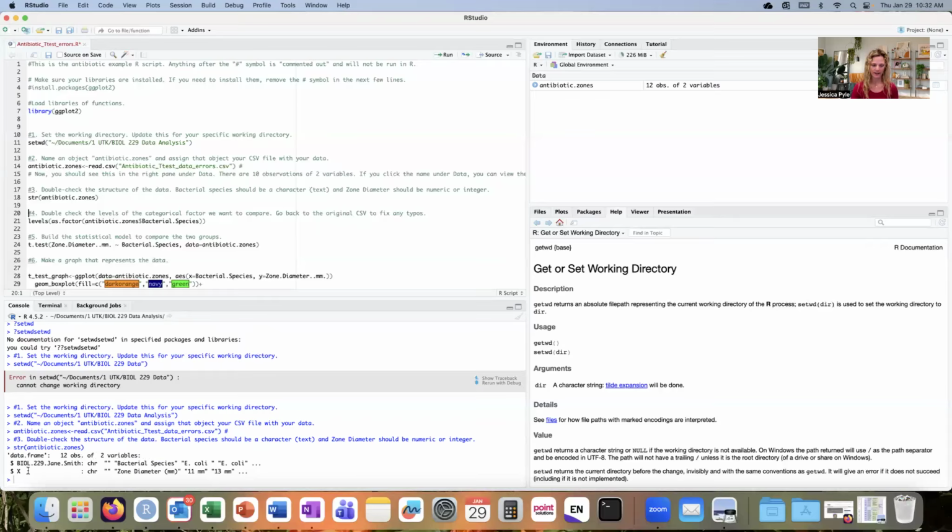I look at the column names and I see I have a column named BIOL229.Jane Smith.